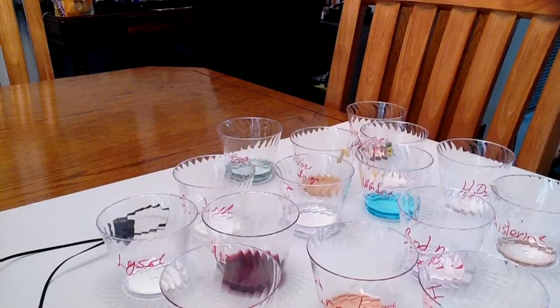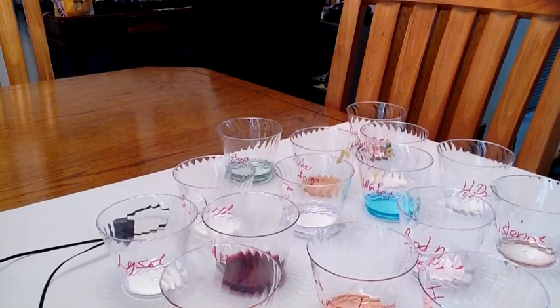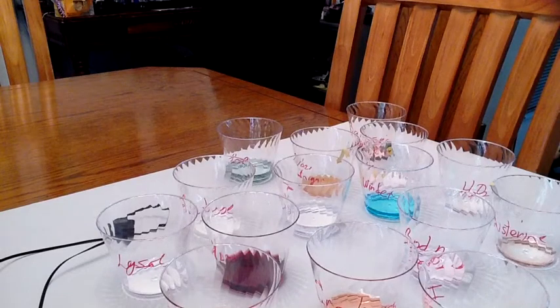She's better with colors. When you're finished, this stuff is safe to throw down the drain. And of course, if the chief chemist in your house says that's ridiculous, then you don't throw it down the drain. Put it in the toilet. If she says it's not safe for the toilet, then throw it outside. If you rinse these cups well, you can reuse them for the next lab.